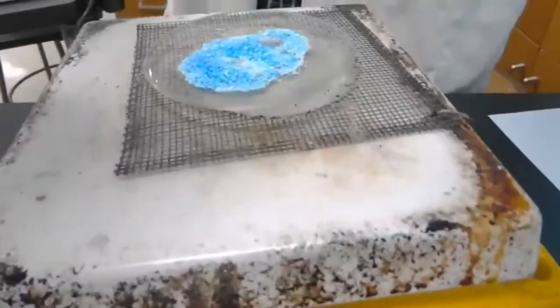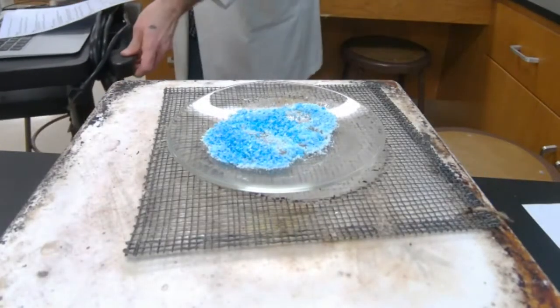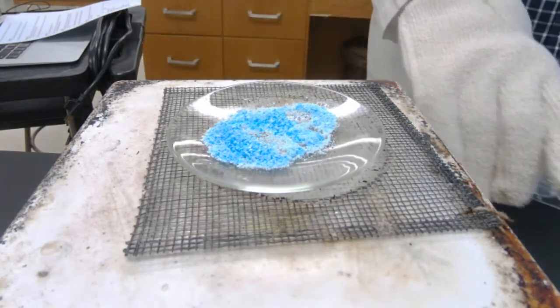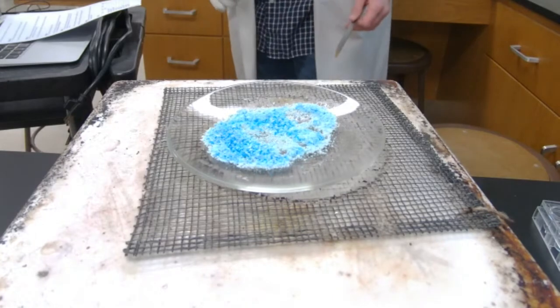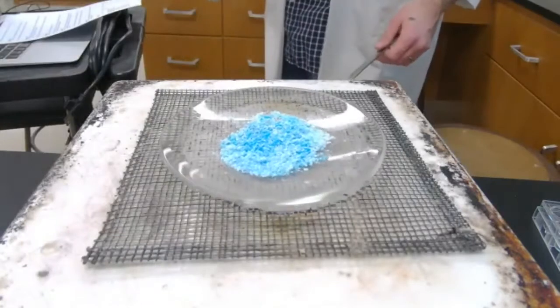Let you guys look at it as I angle you back up into my apparatus there. And while you guys are looking at that, I'm going to bring over my well plate here, so I can set up for the next station, which involves the good old baking soda and vinegar thing. So, go ahead and organize that. I'm going to pull this off there just momentarily. Notice a little bit of change there from our ground powder.